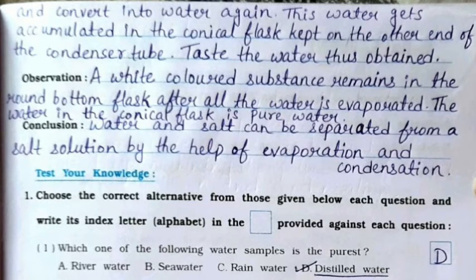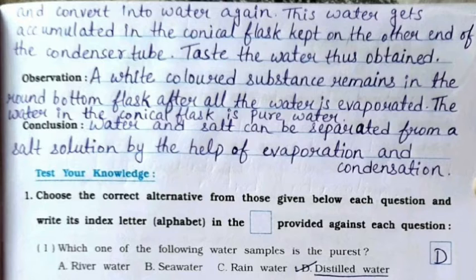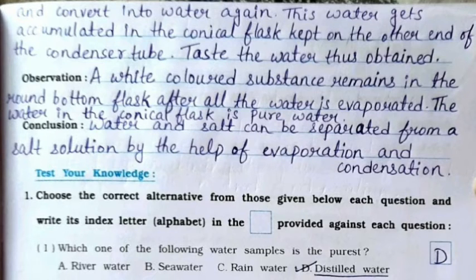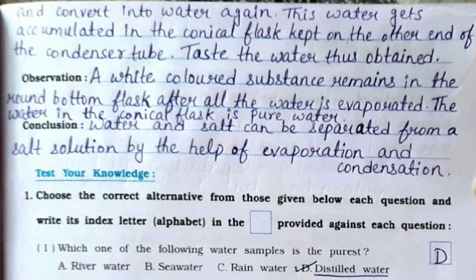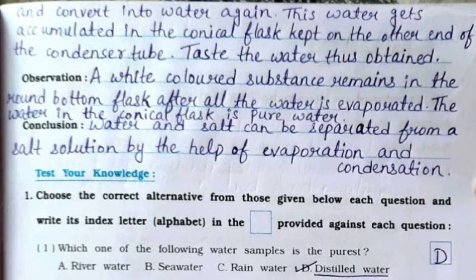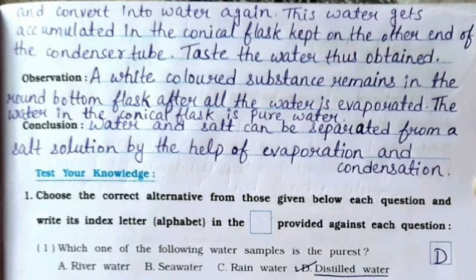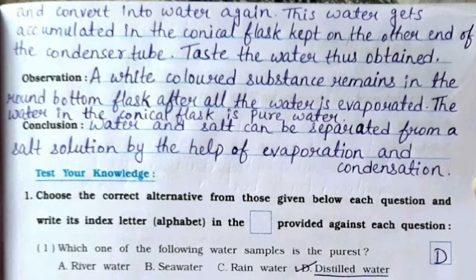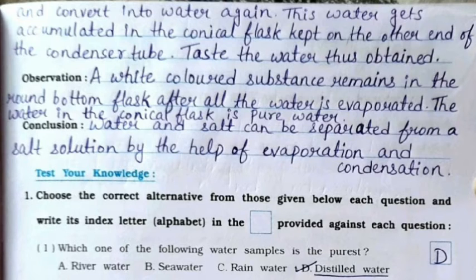The observation is: a white colored substance remains in the round bottom flask after all the water is evaporated. The water in the conical flask is pure water. Conclusion: water and salt can be separated from a salt solution by the help of evaporation and condensation.